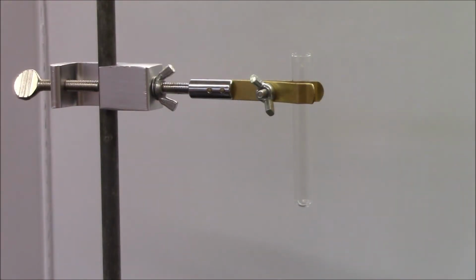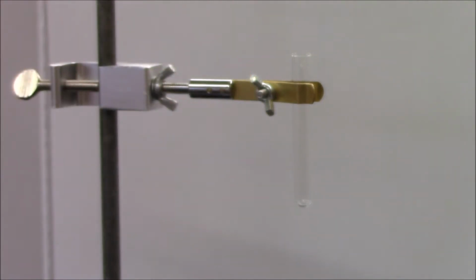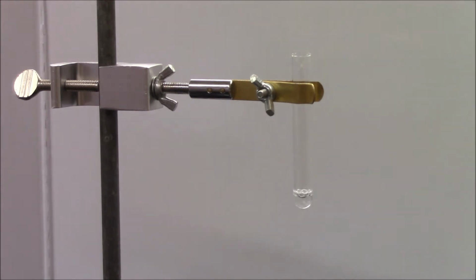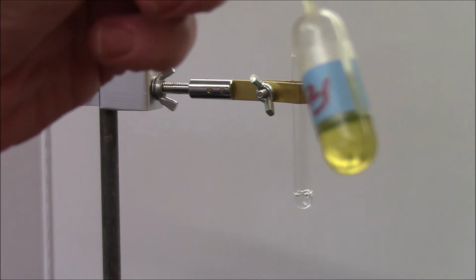In my next reaction, reaction number 3, I am going to be mixing sodium hydroxide and iron(III) nitrate. I'm looking for sodium hydroxide. I know I have it. Here it is. If I bring it into the screen, you can see in the bottom of the bulb that this is also colorless and transparent. I'll add some drops, there we go. And to that, I am going to be adding iron(III) nitrate. When I bring the iron(III) nitrate, you can see that this solution is transparent, but it has a yellow-orange color.